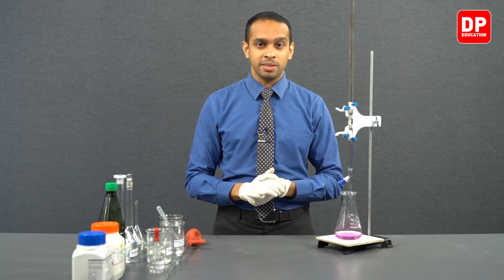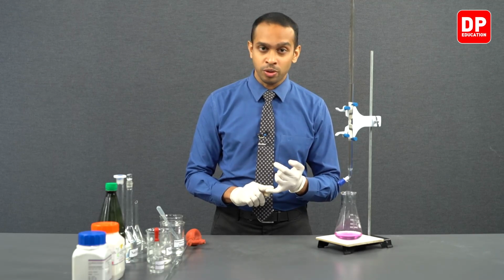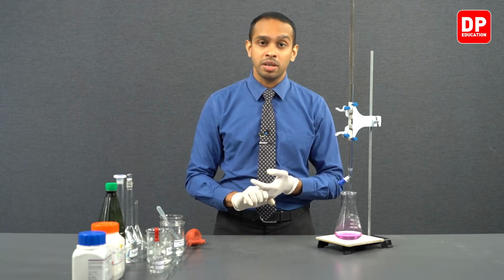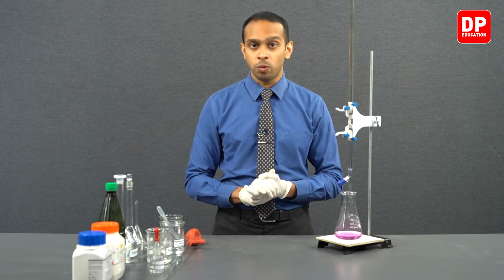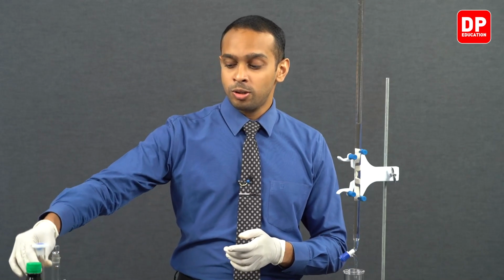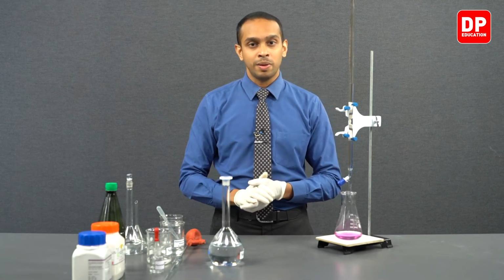Now students, with the third titration we observed the burette reading was 26.4 cubic centimeters. The very first titration gave us a burette reading of 26.3. The second and the third titrations gave us a burette reading of 26.4. So all of these readings are concordant. Now you can collect this data and carry out a calculation to find the exact concentration of the sodium hydroxide solution we prepared earlier in this experiment.